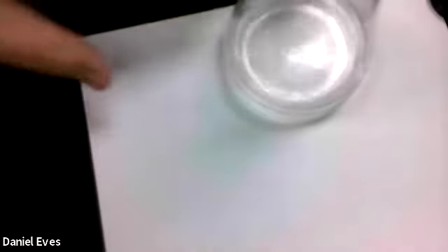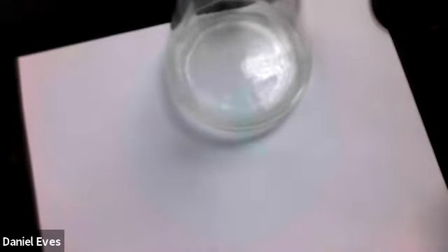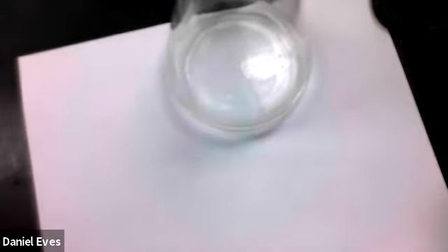Okay, what we're going to do is fill up our burette. All right, so we have filled up our burette, and we hit the 0 mark exactly on this one, so feeling pretty good about life. So let's go ahead and add our phenolphthalein to make sure that we can see the transition of our second sample of the diprotic acid. So we used 35.51 last time, so we should be somewhere in the neighborhood of 35. So let's go ahead and just open the floodgates here and get to about 30, see what happens.